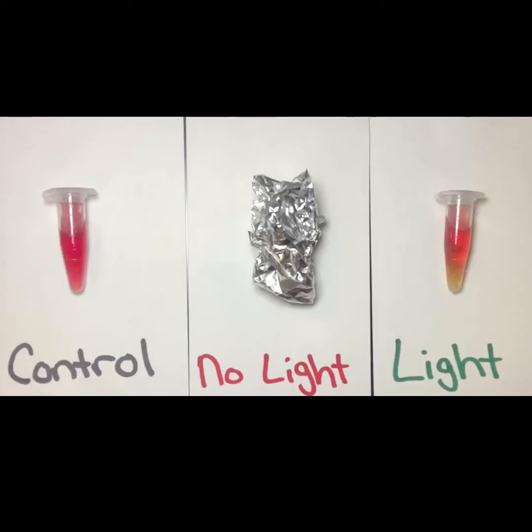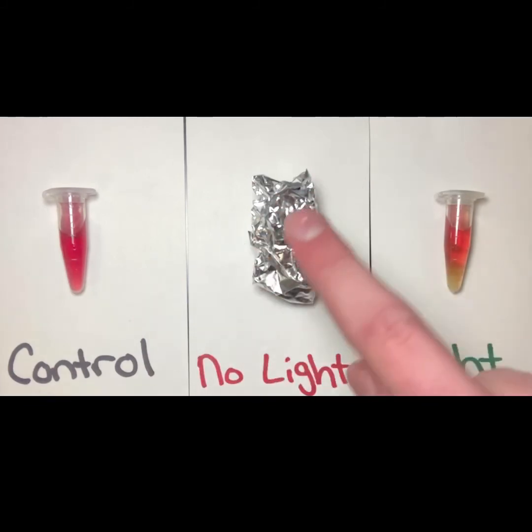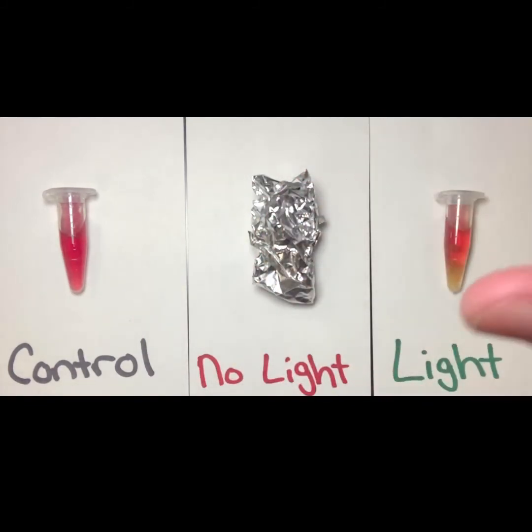I have my control that just has the bicarbonate indicator solution. It doesn't have any algae inside of the container. I have my container that has no light being exposed to it. So I've got the container that has the bicarbonate indicator solution along with some algae that's completely covered so light can't penetrate to the algae beads. And then I have my third experimental setup where I have the bicarbonate indicator solution along with the algae.